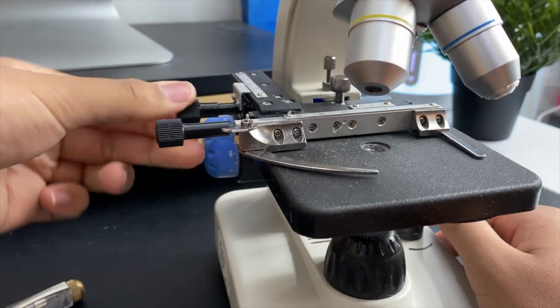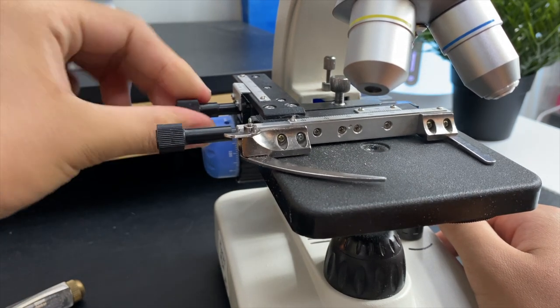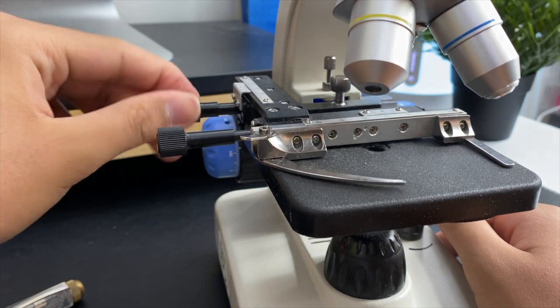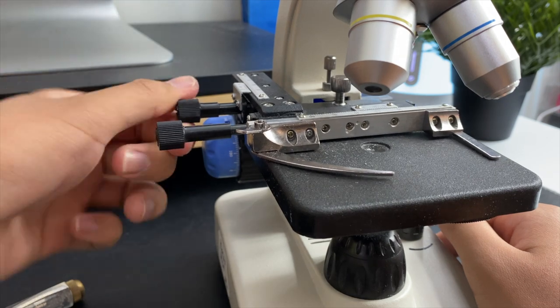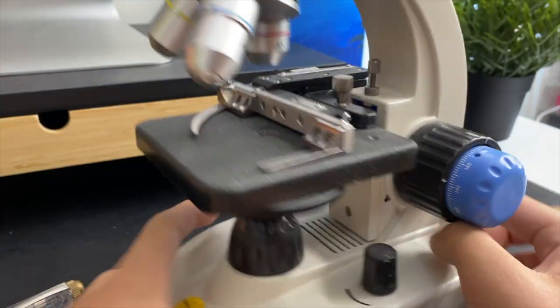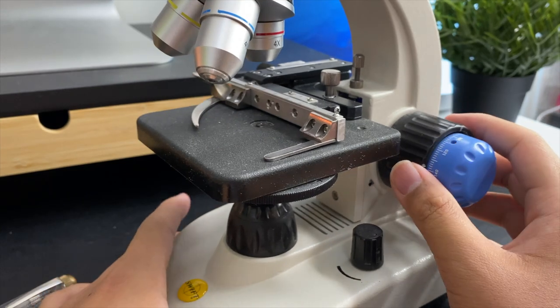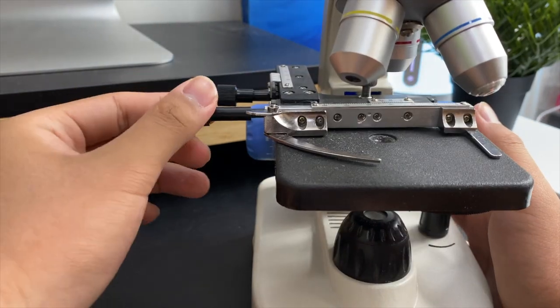Now we can move the stage backwards and forwards, left and right, like the more expensive microscopes out there. And it takes only less than five minutes. It's quite easy.